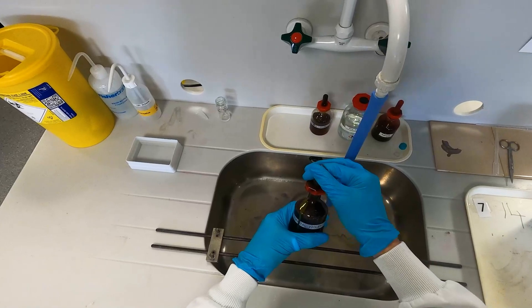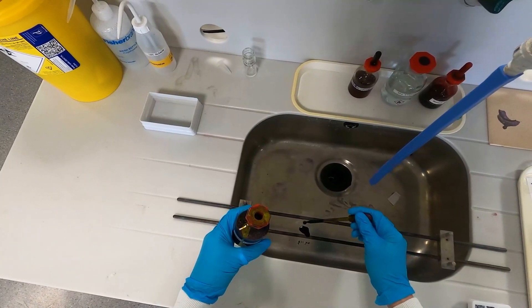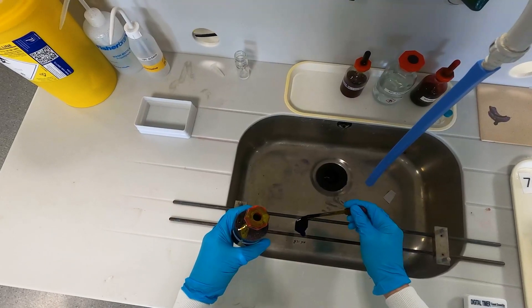The Gram stain is one of the most important techniques microbiologists can learn, but luckily it's also one of the easiest. Today we're going to cover how to heat fix a slide and then how to Gram stain it.